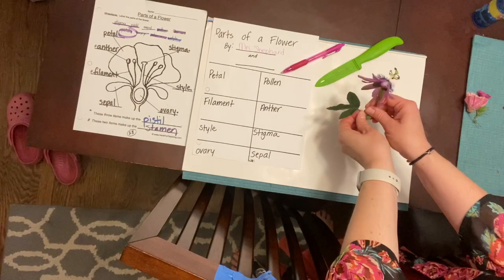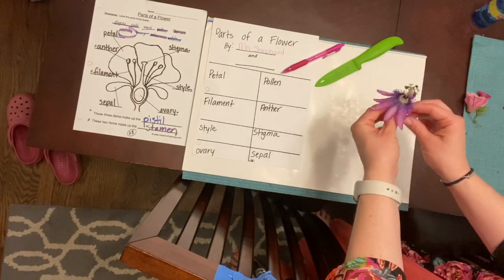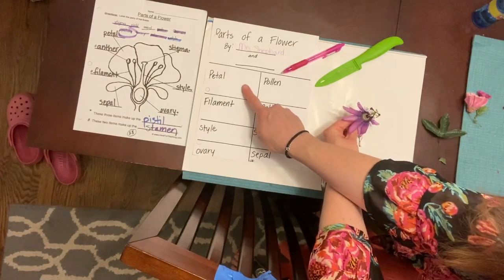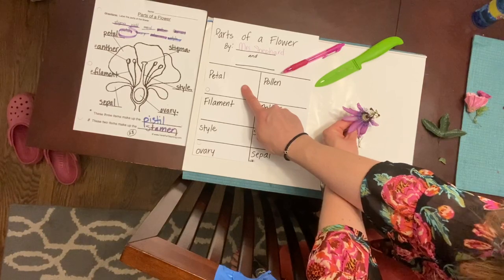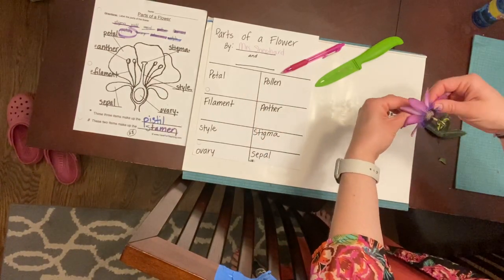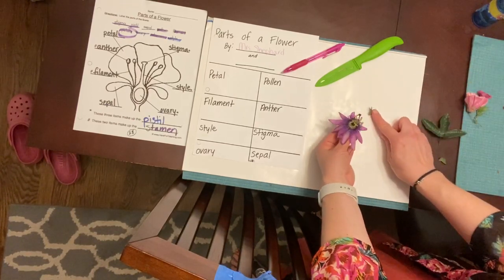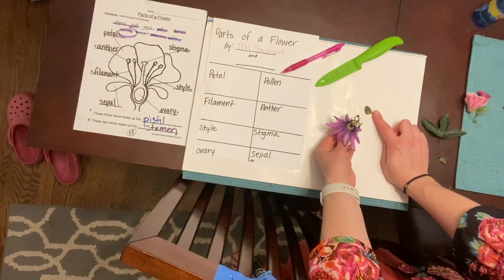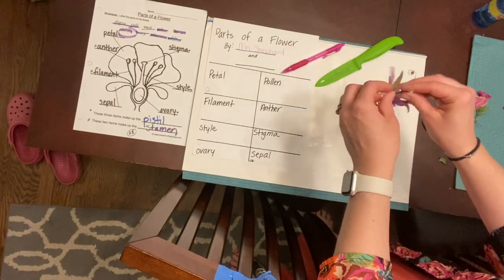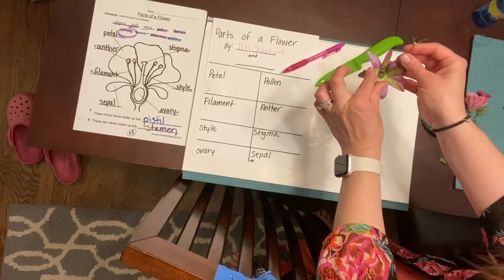If your flower has any leaves on it, you're going to separate the leaves from the stem. And then you're going to start to look for an example of each of the things that is listed on the worksheet. So we need a petal. So I'm going to gently take off a petal. Oh, and something else fell off too, which I know would be the sepal. Okay, so underneath, I hope you can see it all right, I have a few sepals.